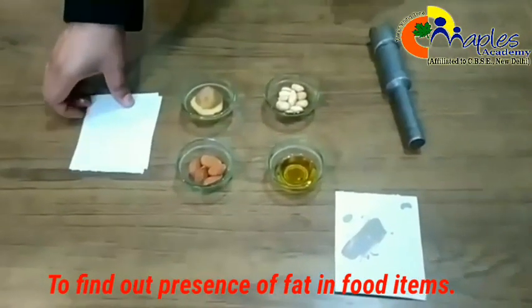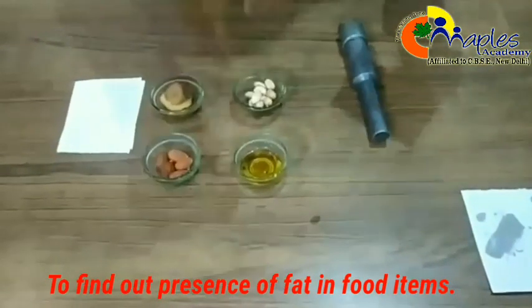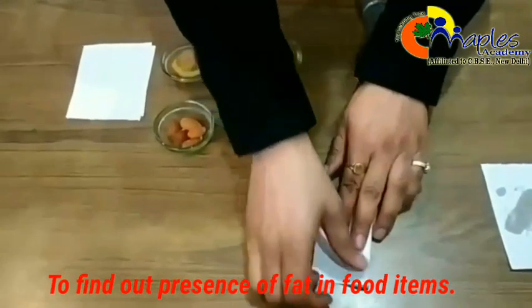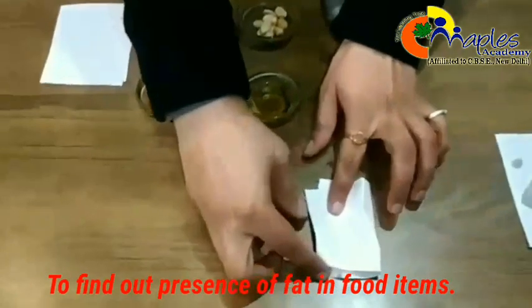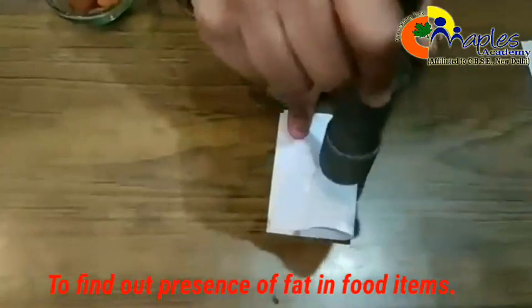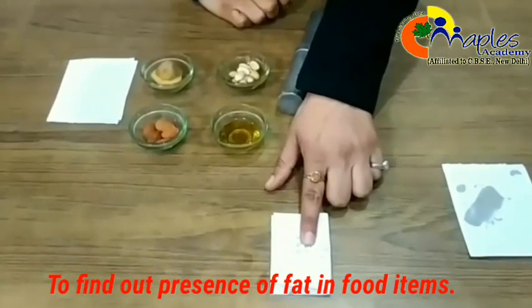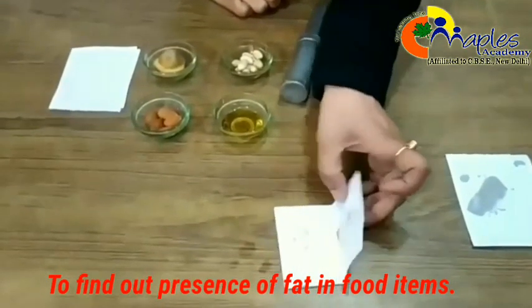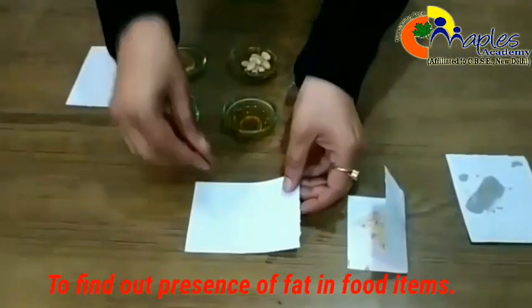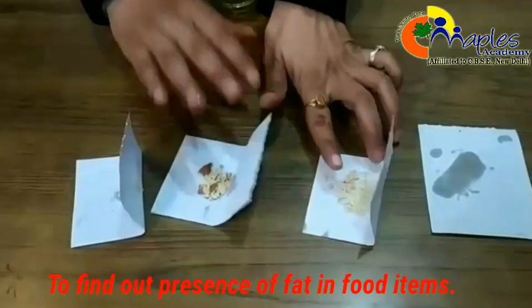For that, firstly we need a paper. Take one paper and one food item. Let's take the peanut and fold it into the paper properly. Keep it properly and now crush it with a crusher. Make sure the paper does not tear in between. Repeat the same steps for all of the other food components. We have crushed all 3 foods in a paper.